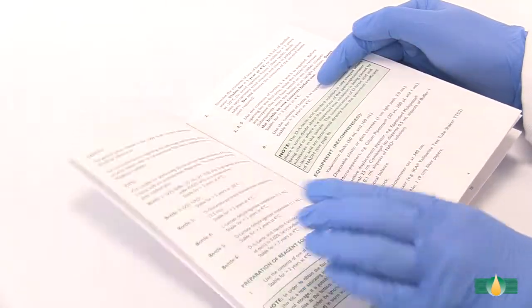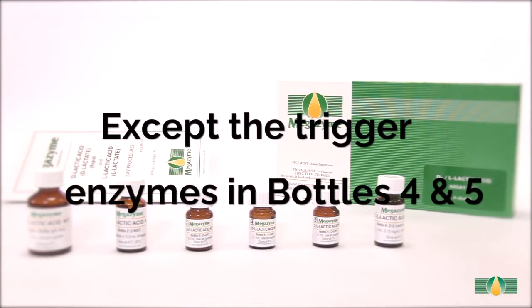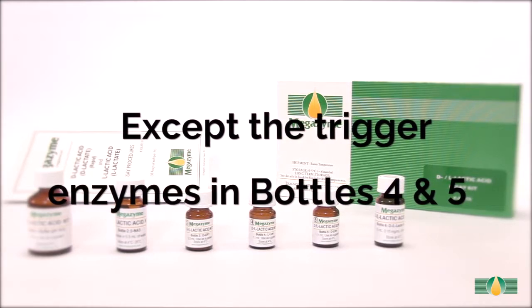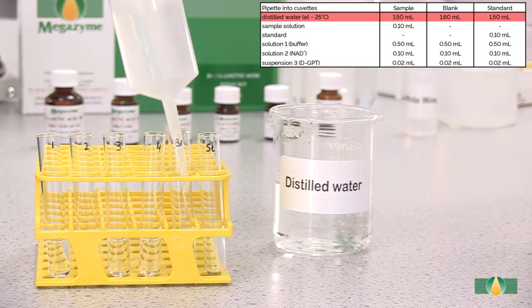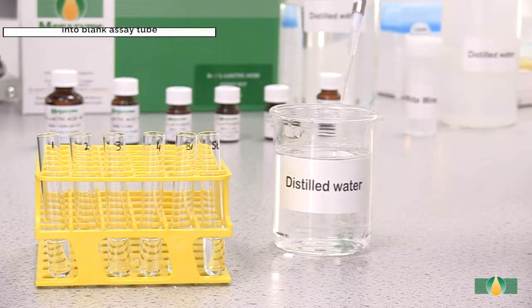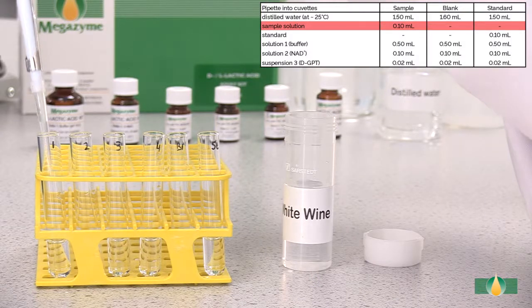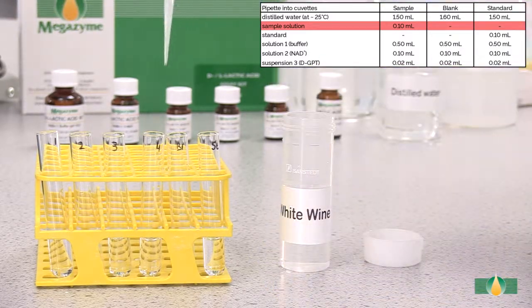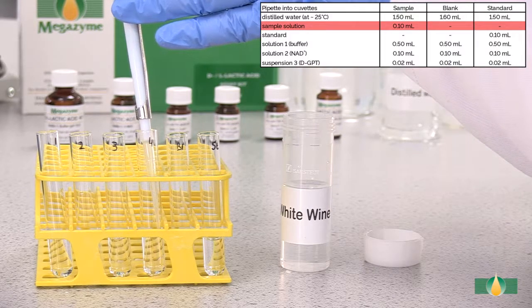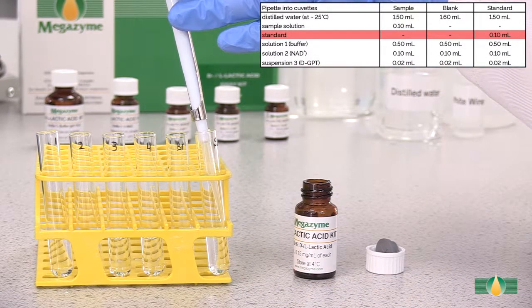Follow the manual assay procedure as described in the data booklet. Pipette all assay components except the trigger enzymes in bottles 4 and 5 into each assay tube. A blank reaction and a standard reaction must be performed with each batch of samples. Pipette 1.5 millilitres of distilled water into all assay tubes. Add an additional 0.1 millilitres of distilled water into the blank assay tube. Pipette 0.1 millilitres of sample to sample assay tubes. Pipette 0.1 millilitres of kit standard into the standard assay tube.